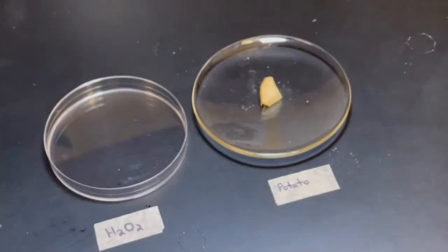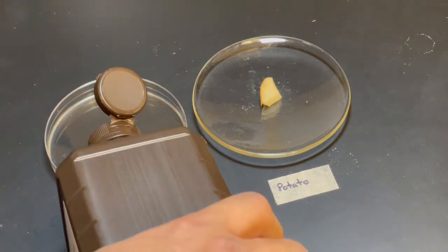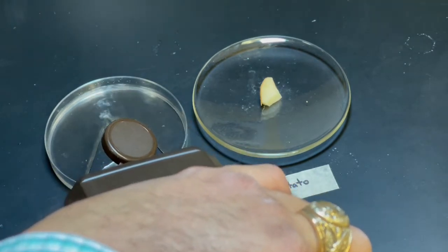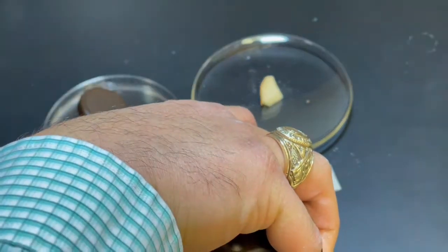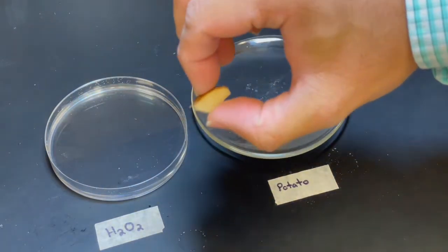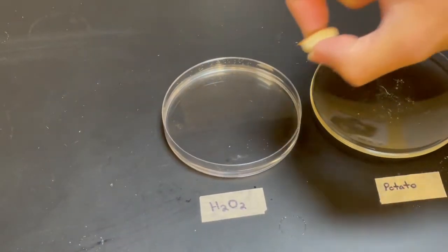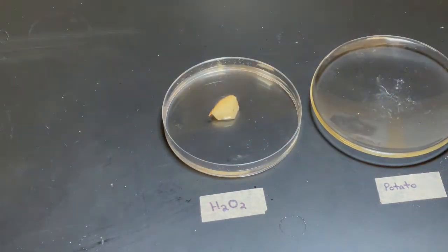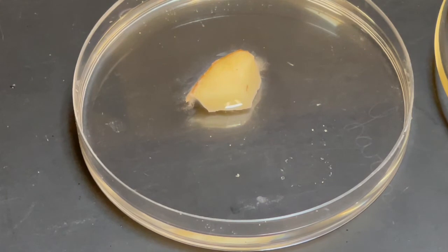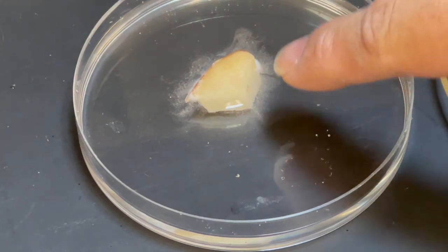We have hydrogen peroxide. We have a potato. This is the catalyst for this reaction. So let's see what happens when I place it in the hydrogen peroxide. Immediately you'll see something here.